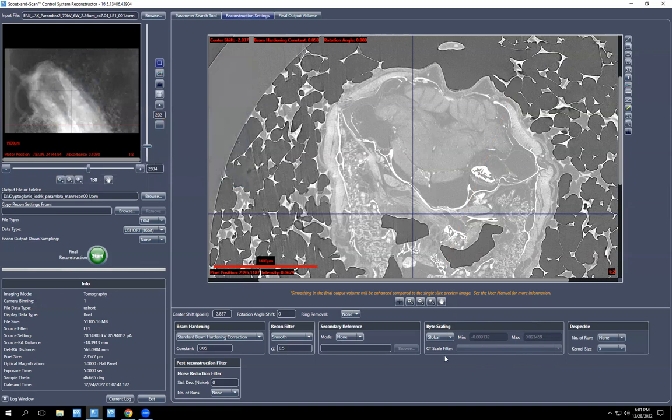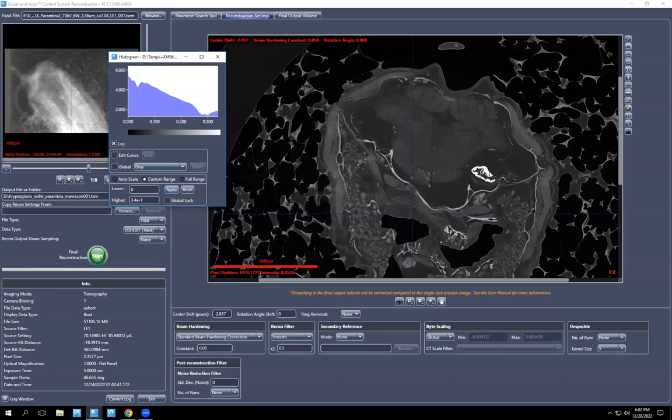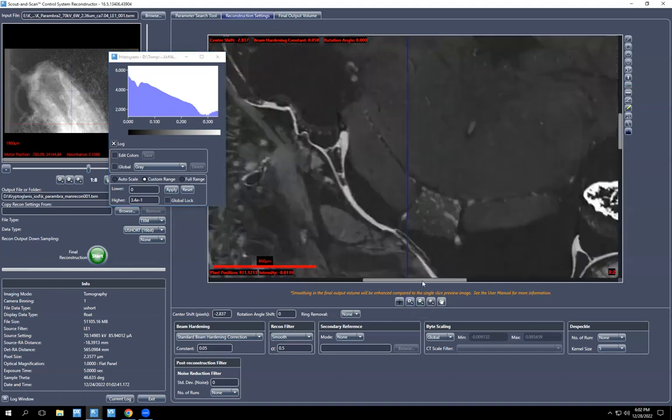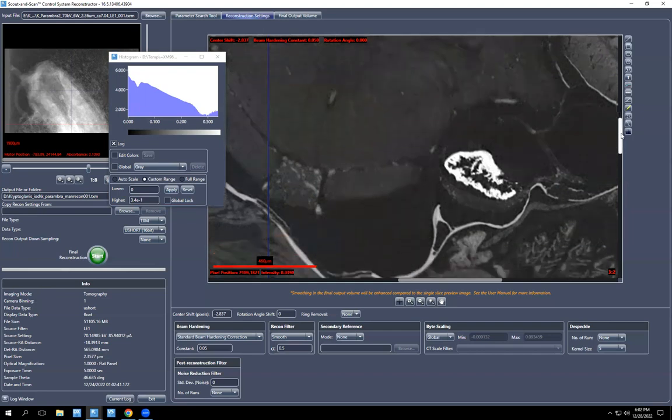So before you commit to your numbers, you can open histogram again, and you see how your numbers change your data. Custom range is what you want. I want to do 0 and I want to try, let's say, 0.34. Hit apply. Boom. So now your otolith is the whitest white, and your lowest density is fully black at 0. We can zoom in and see that the otolith is like overexposure when you take an image. So this overexposure is a bit much.